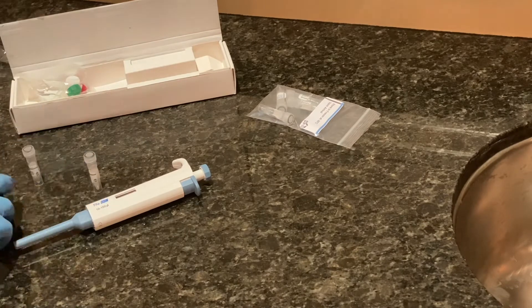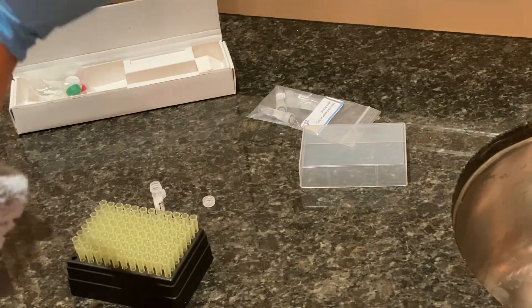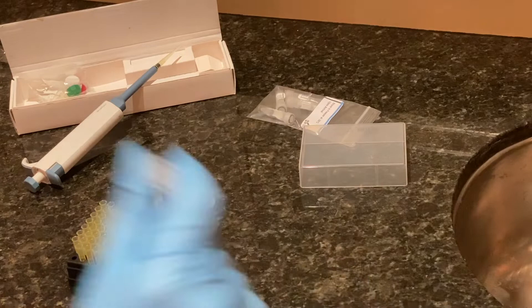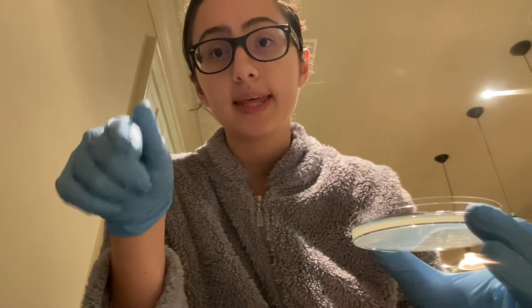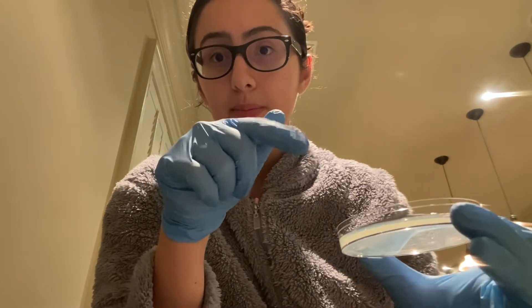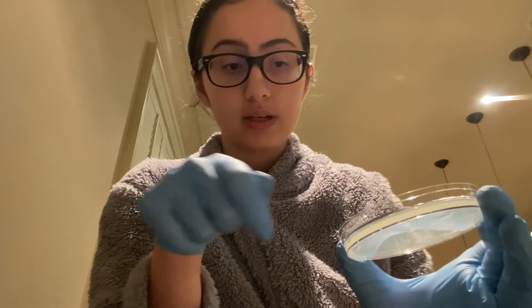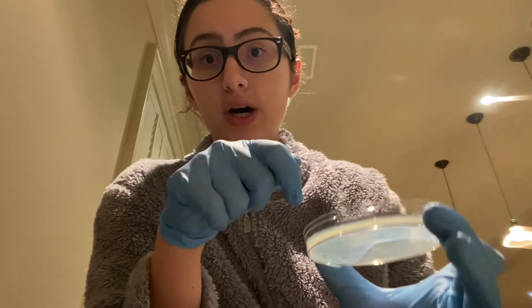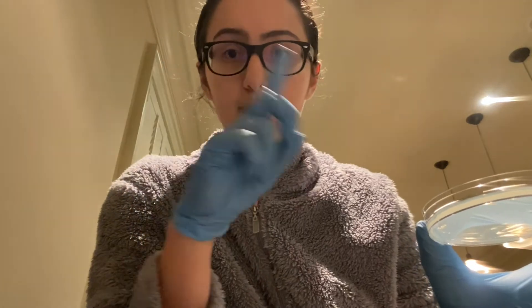After the agar is prepared, we're going to grow the bacteria. To access the E. coli, we put sterile water into the tube using a pipette. Then we shake the tube containing the E. coli and the sterile water for one minute. We take out the E. coli with a pipette, put it at the very corner of the agar plate, and then using an inoculation loop, do little crisscross patterns without breaking into the agar itself — just spreading it on the surface. Now we let it dry and put it somewhere at 37 degrees Celsius to grow for one or two days.